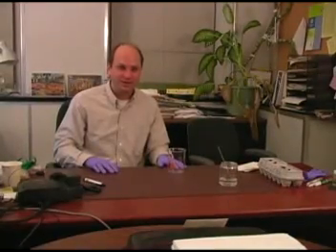So what we're going to demo now is that you can do the same thing — making an egg go from clear to white with acid. We're going to put an egg in here and pour some acid on it and show what happens.